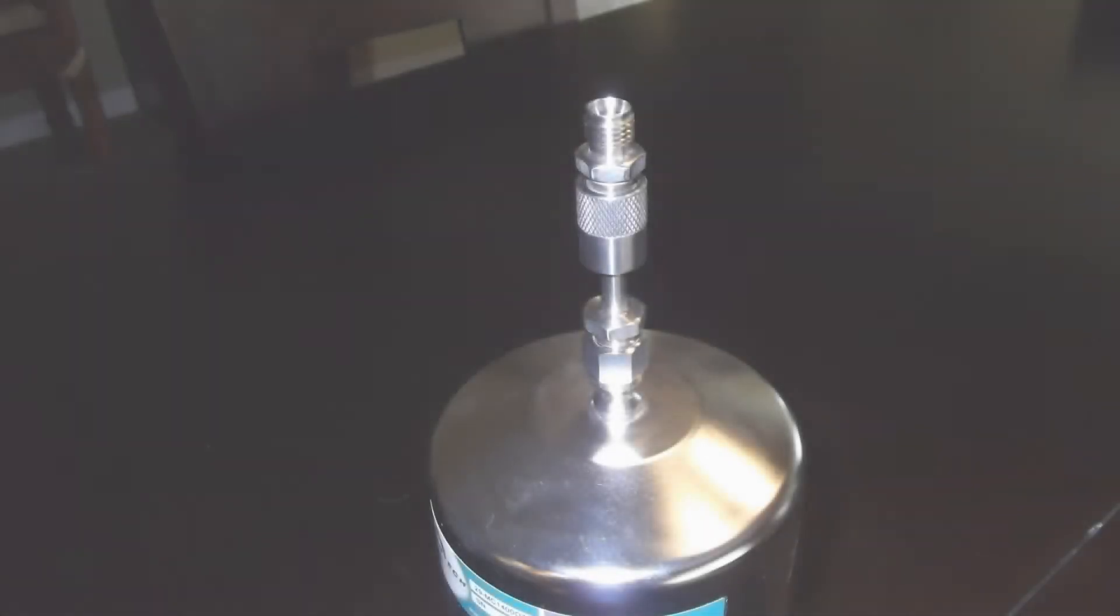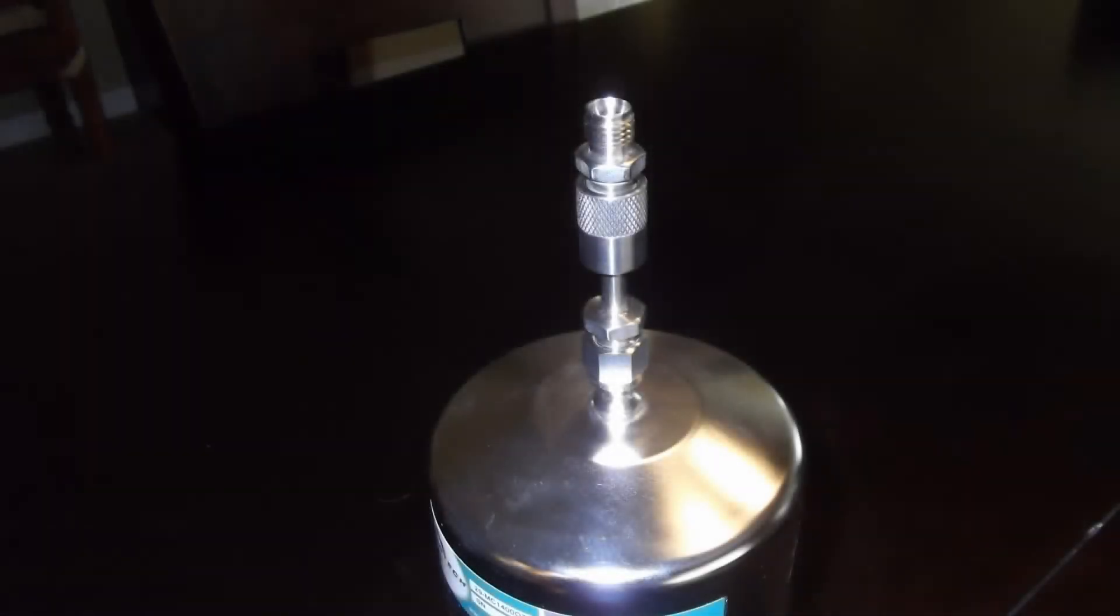You will hear a hissing sound as the air is drawn into the minican. When you no longer hear the hissing sound, the sampling is complete.